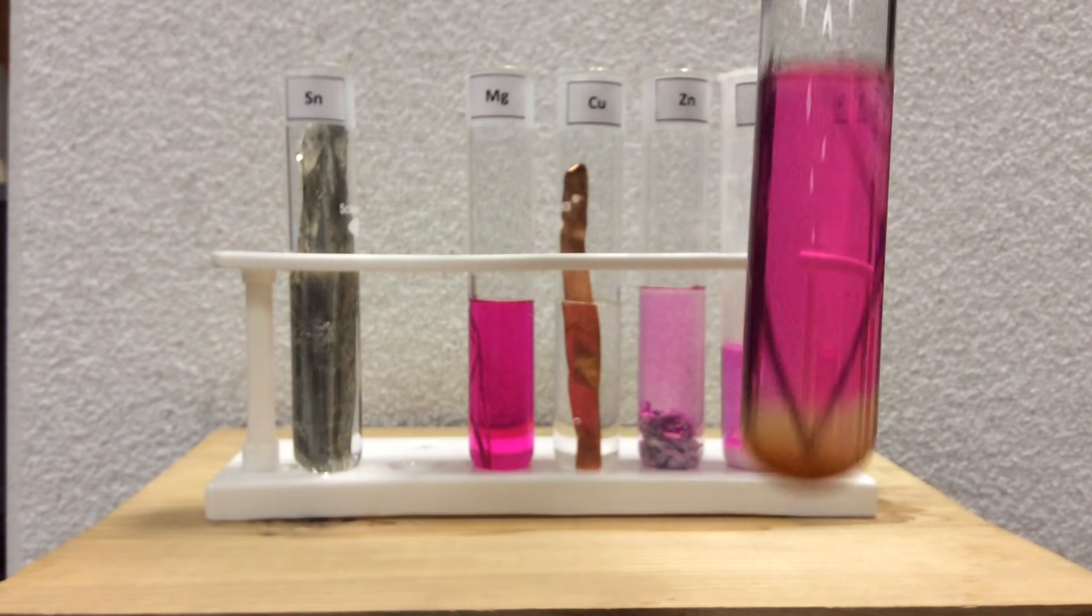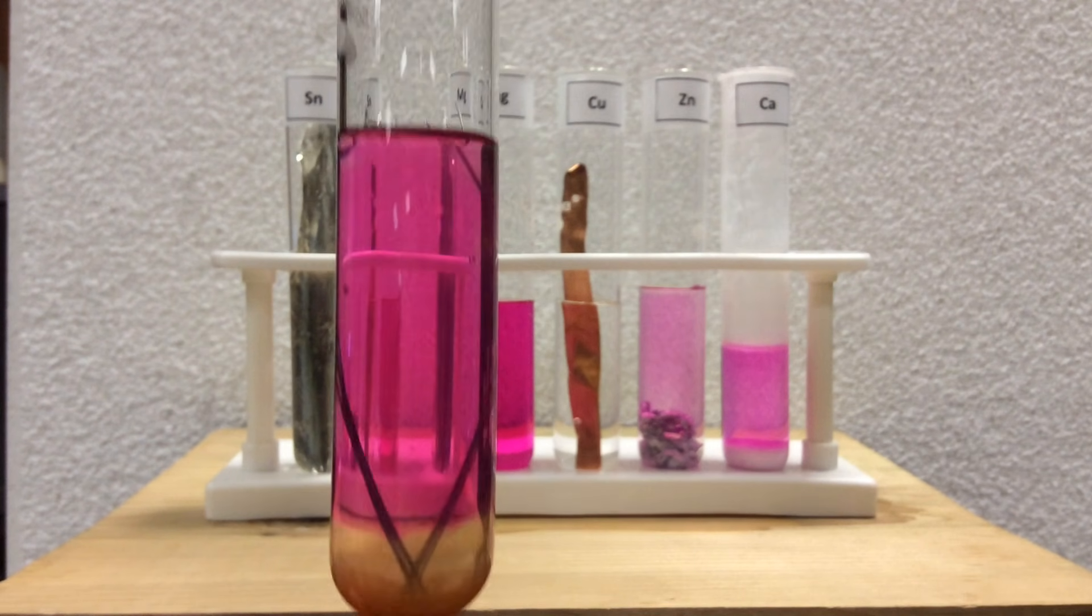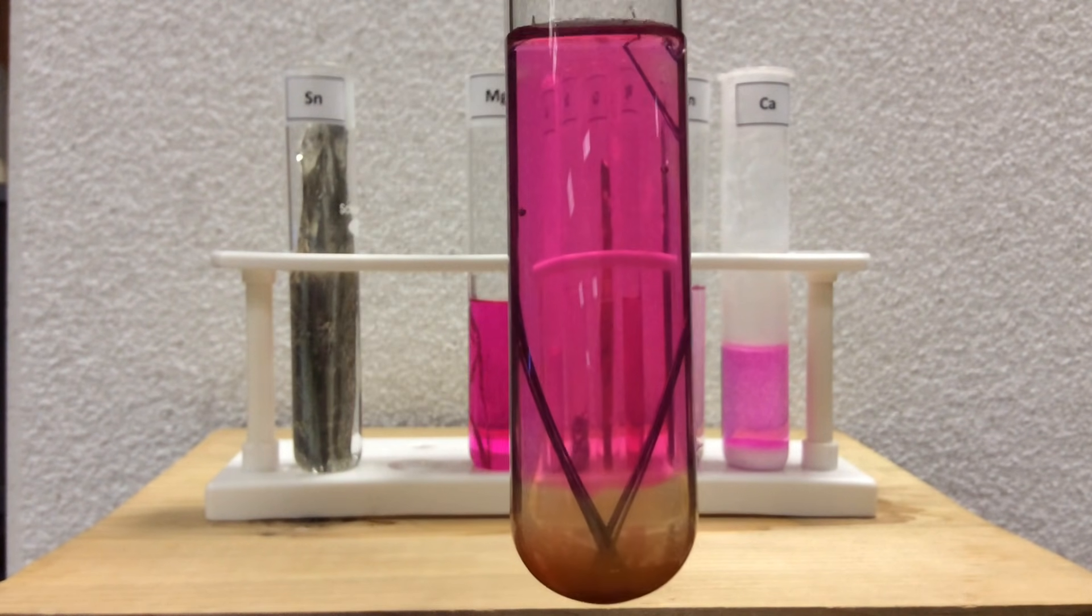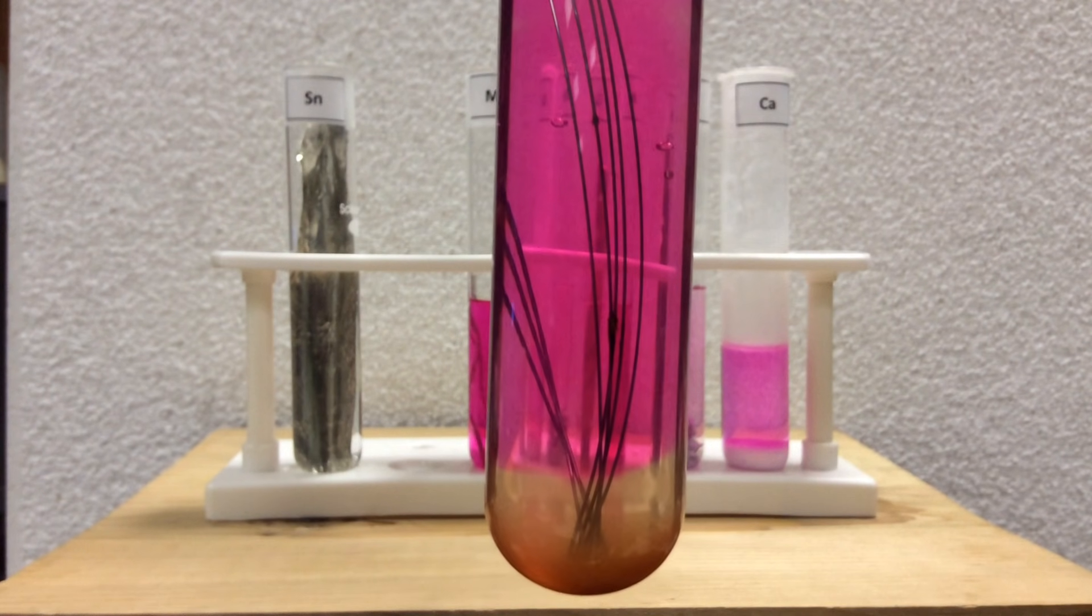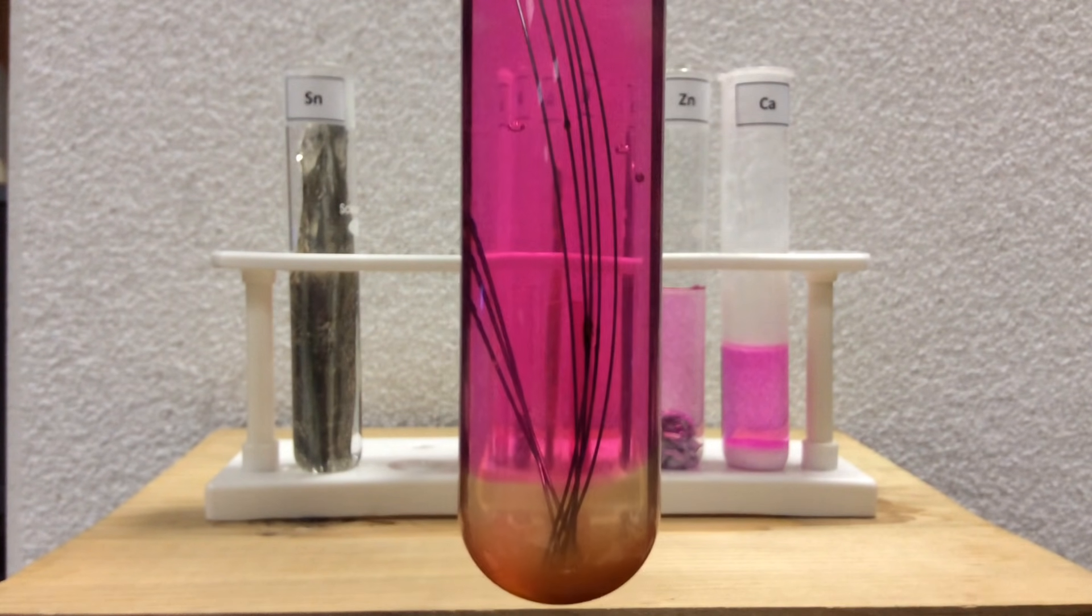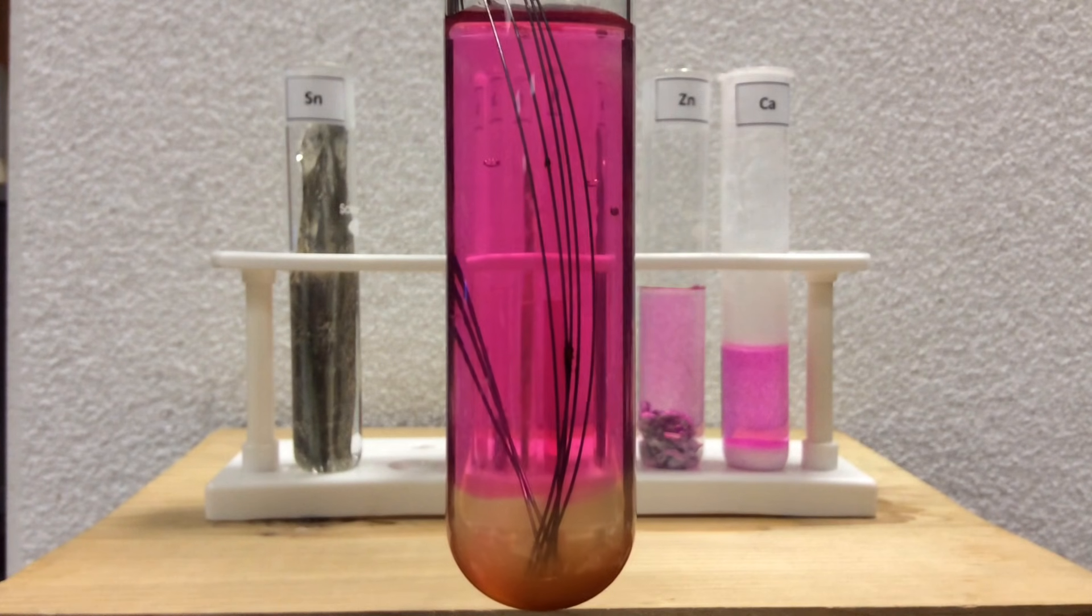Iron, which we just saw very little, which is some bubbles. We can clearly see the pink color. You can also see that orangey red color on the bottom. That's indicative of iron ions being made as well, building up on the bottom. So, clearly, iron is reactive.